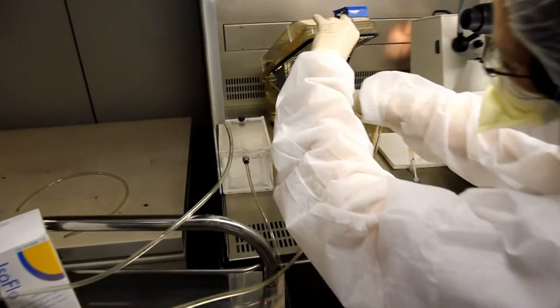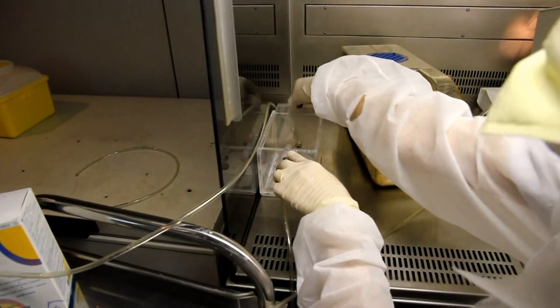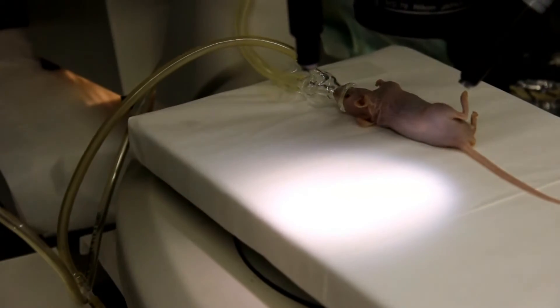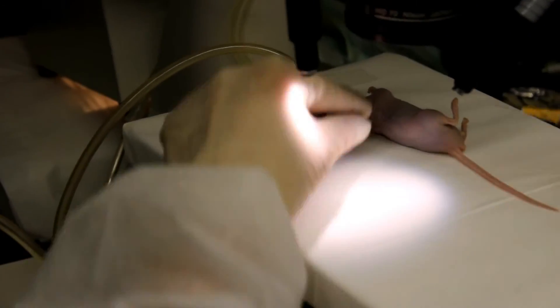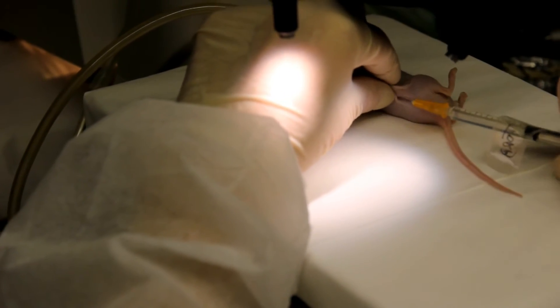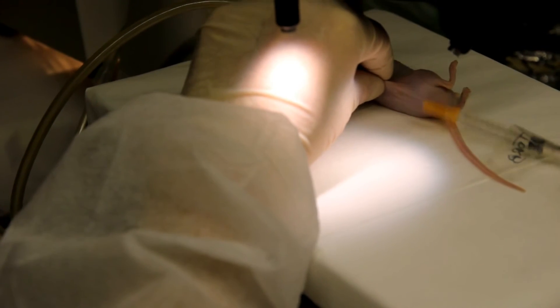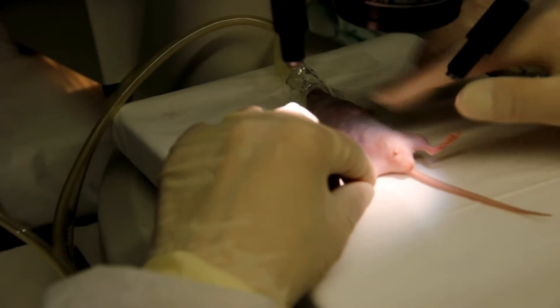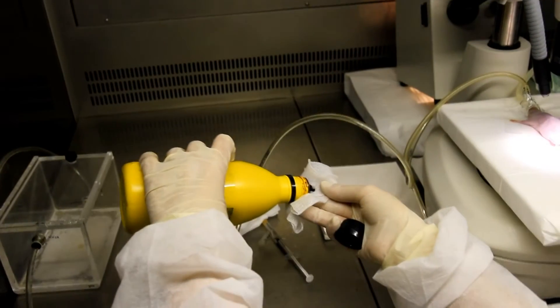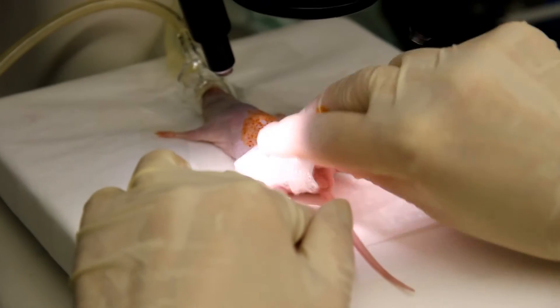After preparing the experimental setup, we proceed with the anesthesia of recipient animals. In this case, we use 5% isoflurane. Additionally, analgesia administration via subcutaneous injection of 0.1 mg per kg of buprenorphine is recommended to relieve pain in the animals after the surgery. It is also important to carefully fix the animal with the anesthesia inhalator to the platform of the microscope. Then clean the abdominal area with betadine before starting the surgery.